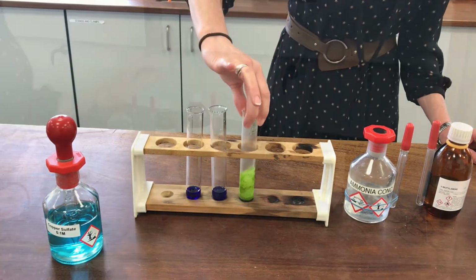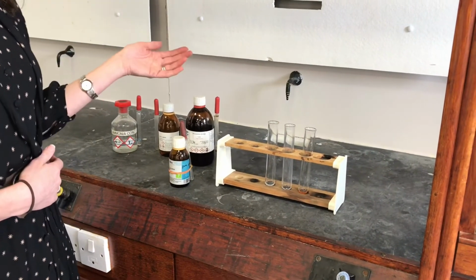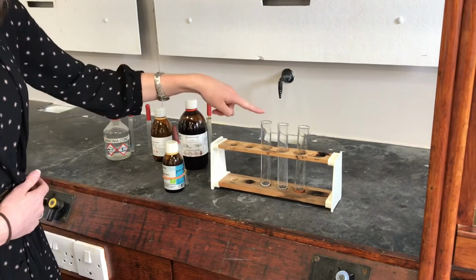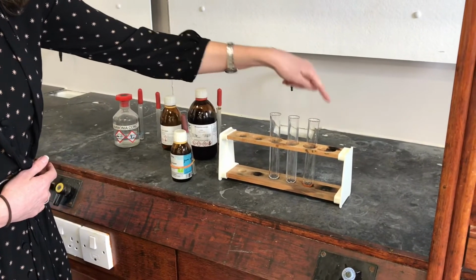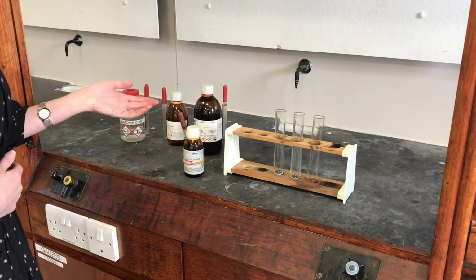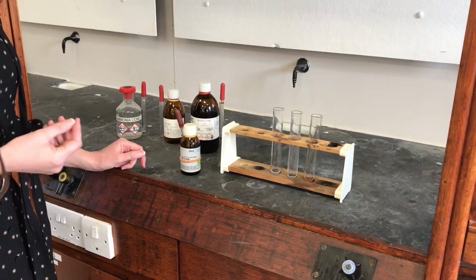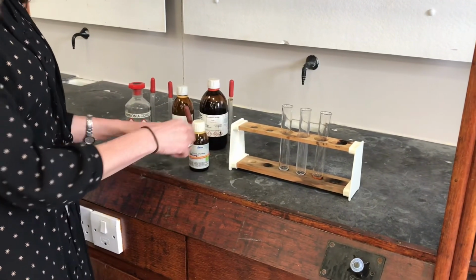In this final experiment, we're going to try a nucleophilic addition-elimination type reaction. So I've got the amine already in my boiling tube, so ammonia in this one, butylamine in this one, and phenylamine in the last one. And I'm going to try adding some ethanoyl chloride to it. So this is the work that you did in the carboxylic acid derivatives topic, but we're looking at it from a slightly different perspective now because our main focus is the amine rather than the ethanoyl chloride.